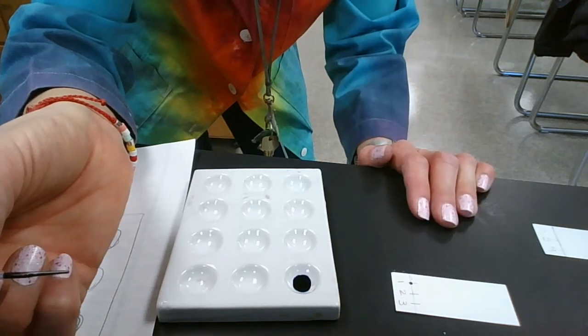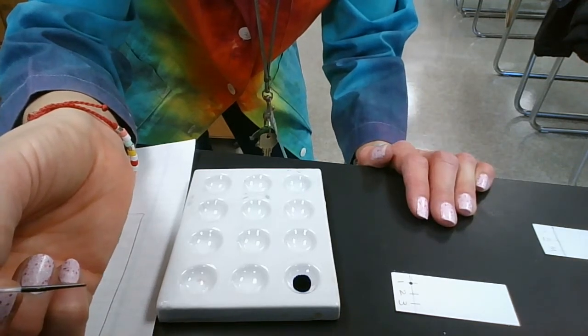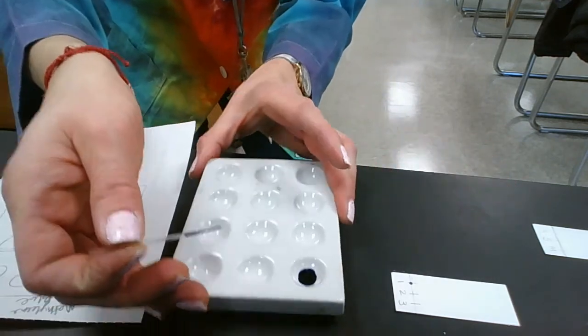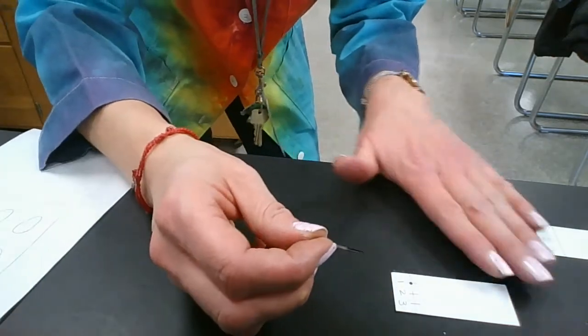That's almost perfect. If you think that you need a bigger or darker spot, you want to wait until you think that this spot has dried. I'm going to just move this so I don't have my arm in it.